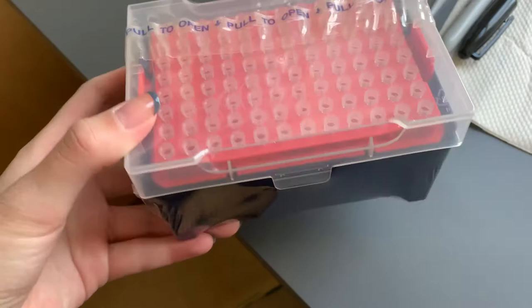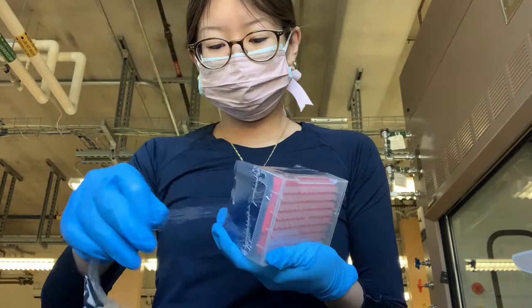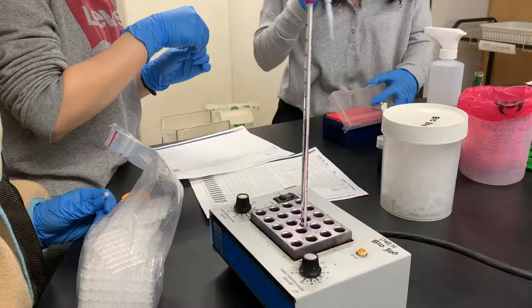For PCR, we used special pipette tips that had extra filters to avoid contamination from the pipette to the sample. PCR is very sensitive, so it's important to take precautions when handling the materials and equipment involved.